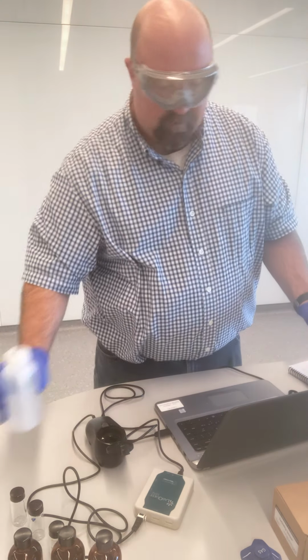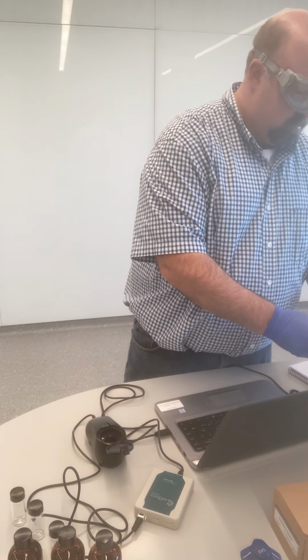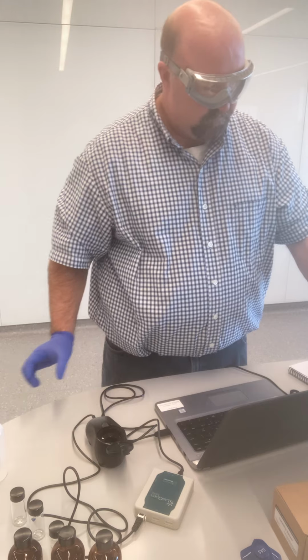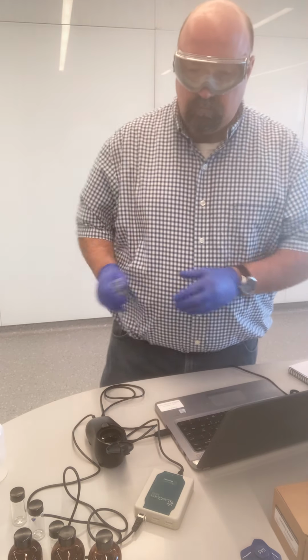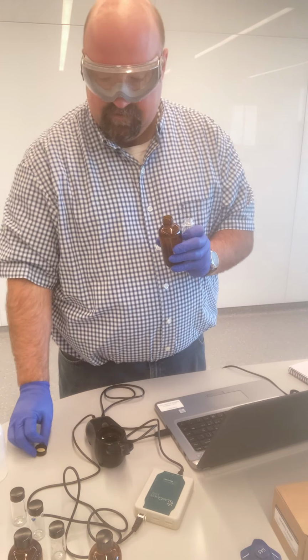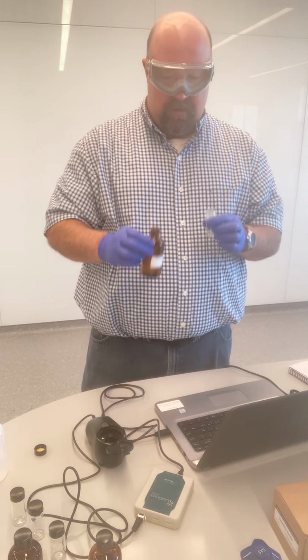So dump out sample spot 2, or sorry, dump out sample spot 1. Add in sample spot 2.